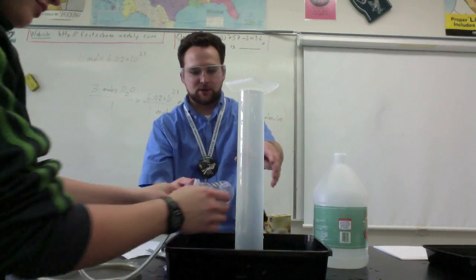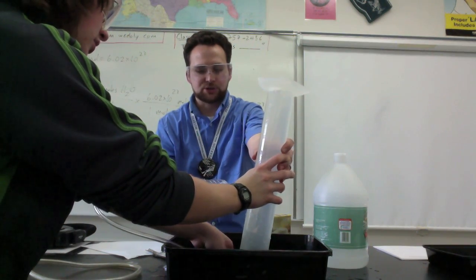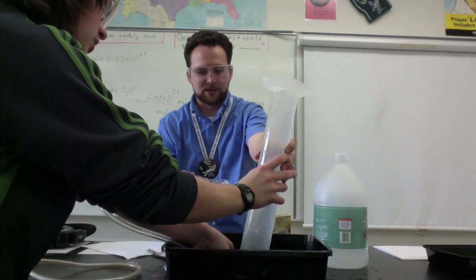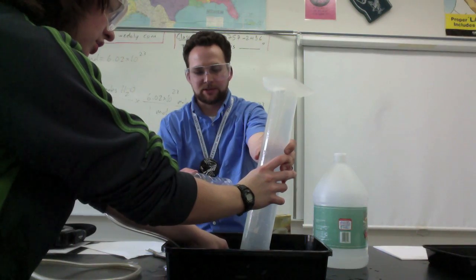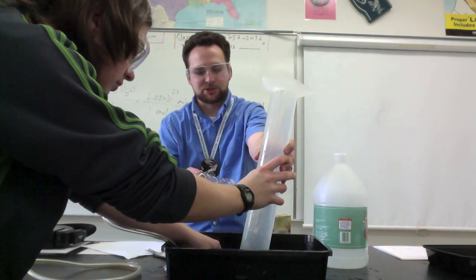And now she's going to actually thread this underneath the graduated cylinder. You don't want to pinch it too much, so you're going to have to kind of tilt it a little bit. If you pinch it too much, you're not going to be able to collect that much gas.